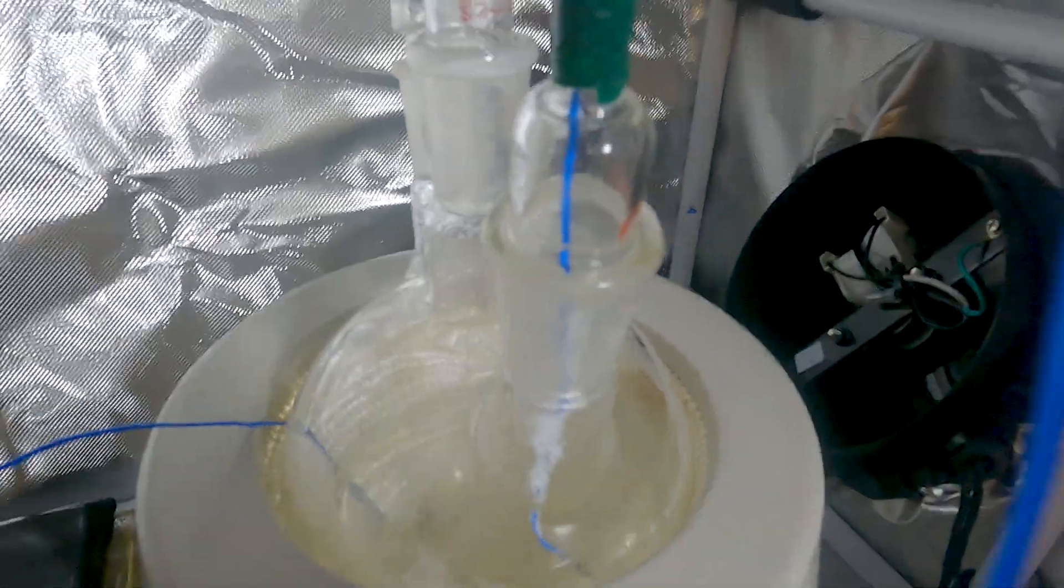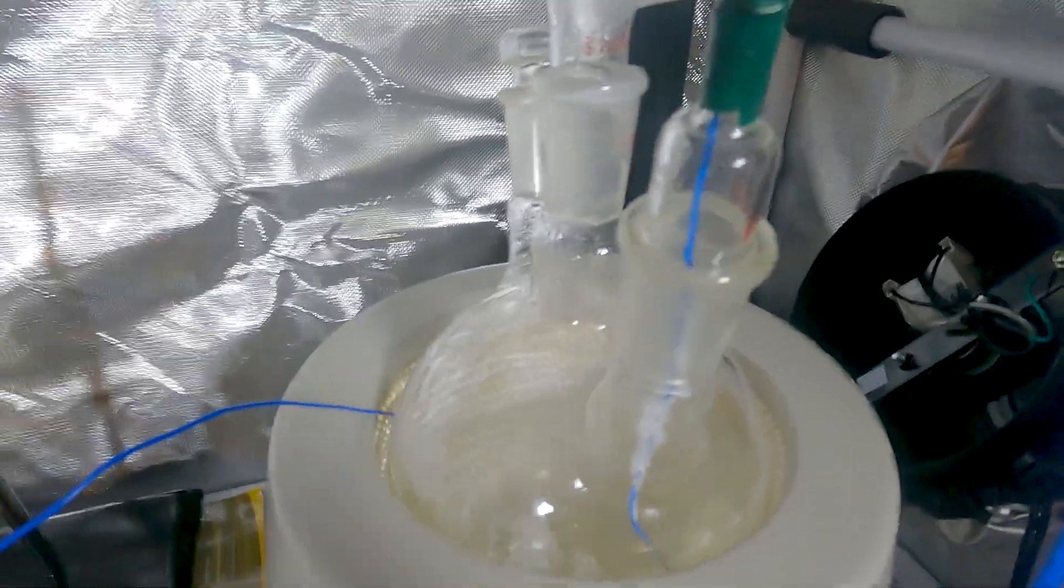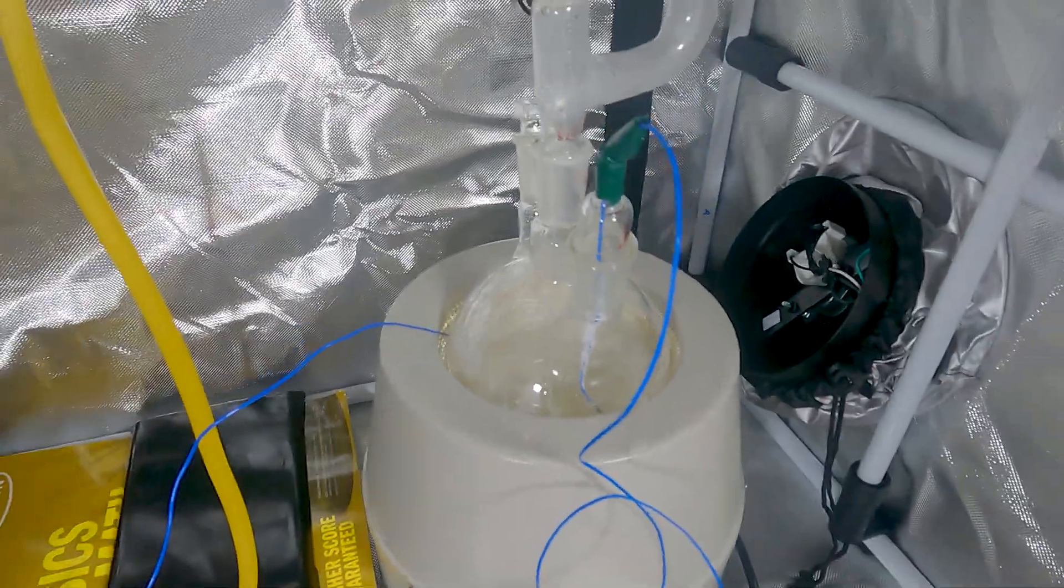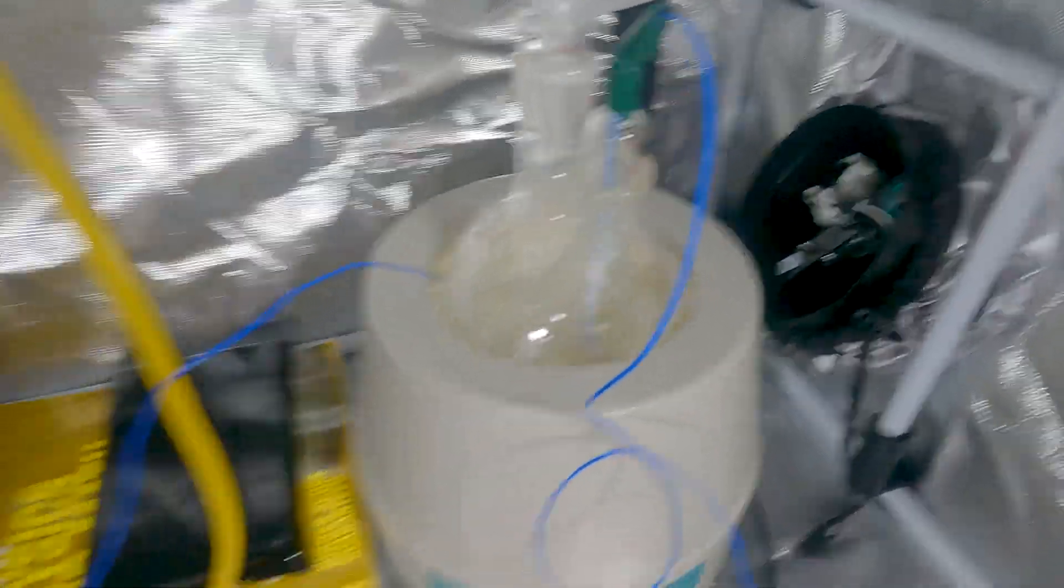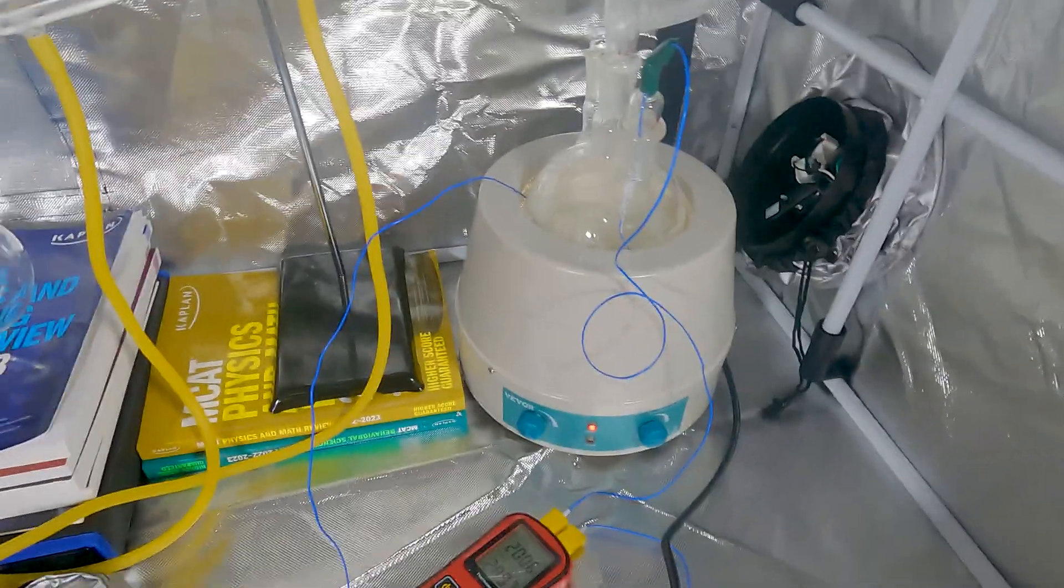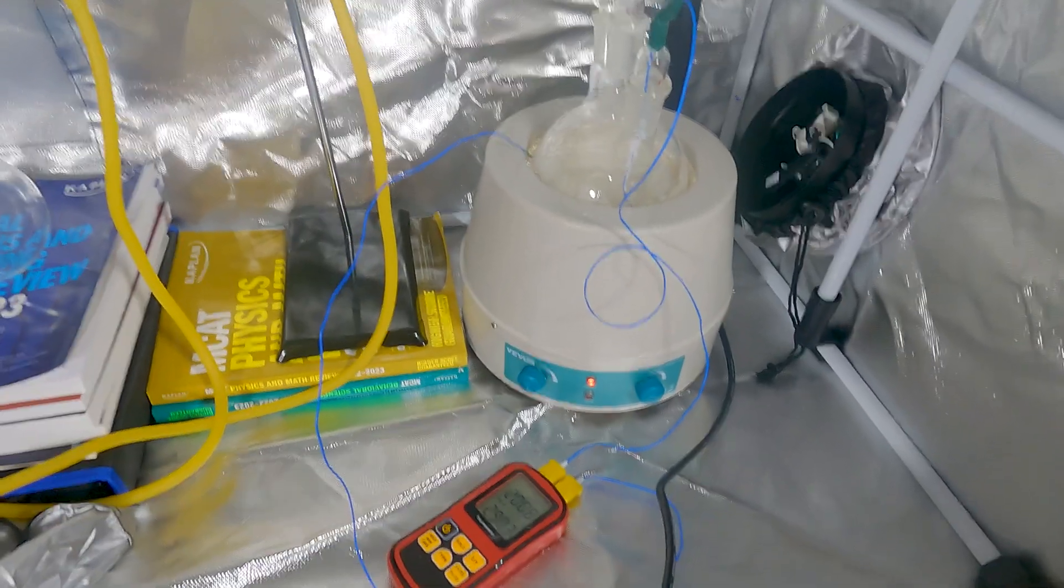It doesn't look too bad. It's not boiling that much. So I guess I lucked out on the quality of what I ordered, which is good. I just got the adipic acid off from Amazon.